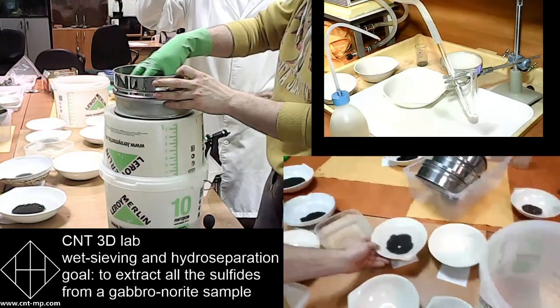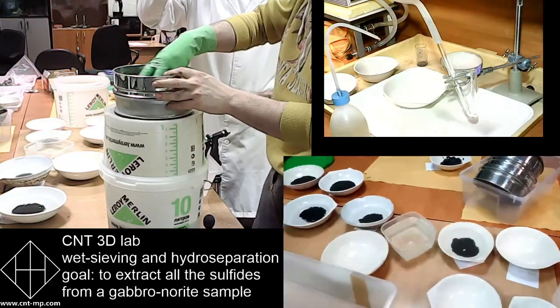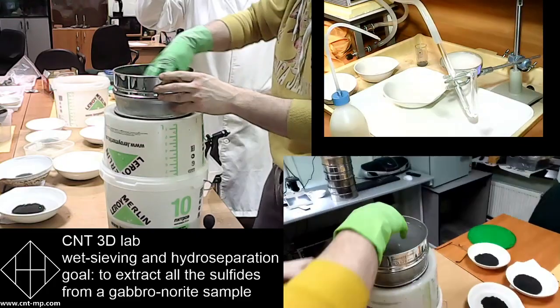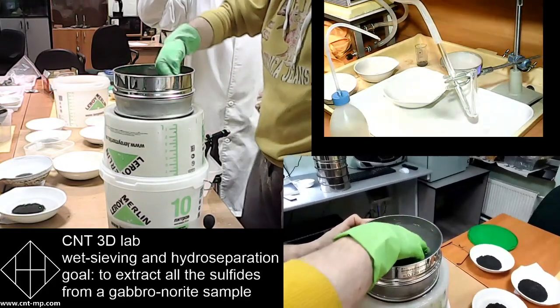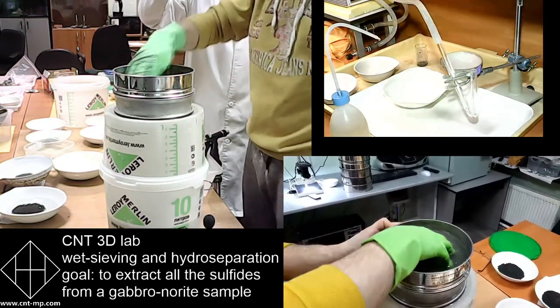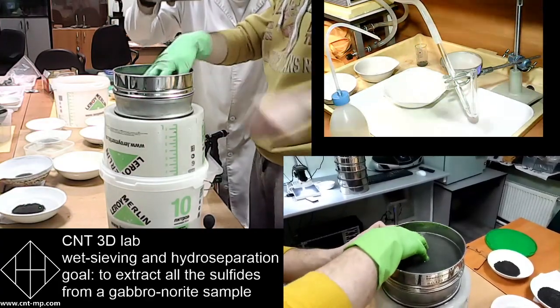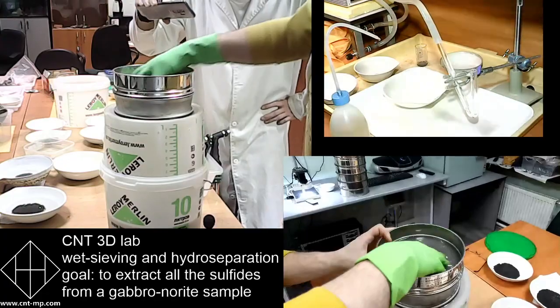See, whatever is spilled can be reunited. That's it. This is how we reach ideal weight balance, because we do not lose a particle, which is not possible with automation.